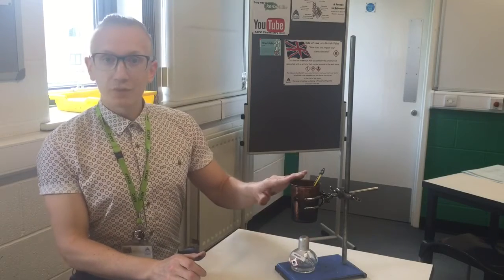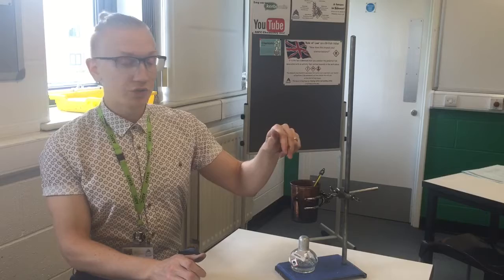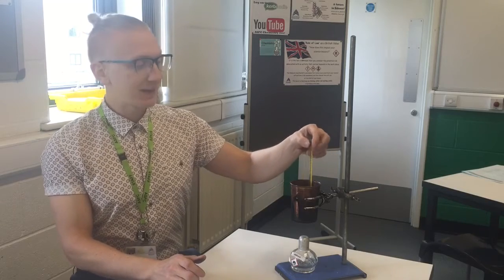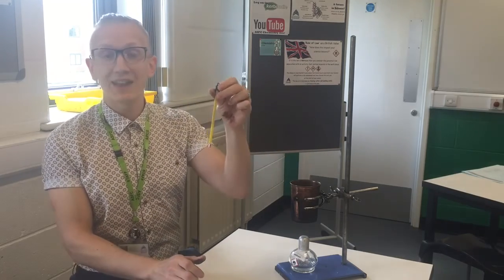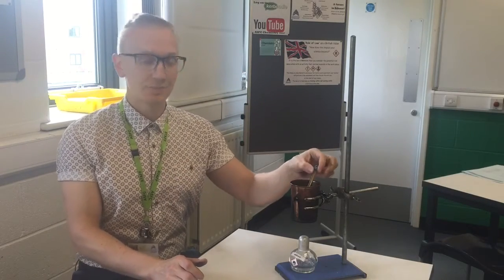What we need to record up here: we need to know the mass of the water inside the calorimeter, inside our copper can. We also need to record the starting temperature and then the maximum temperature reached, because that gives us a delta T.